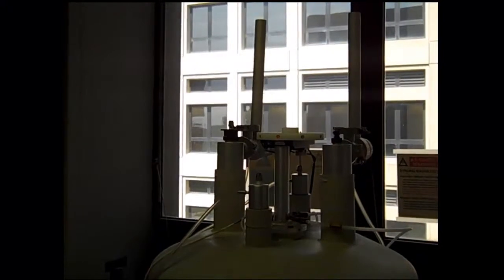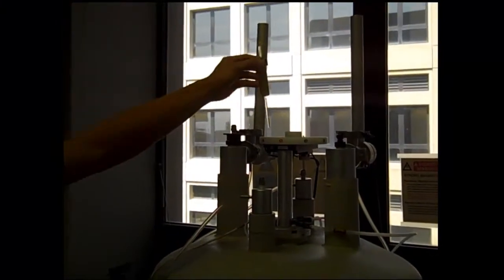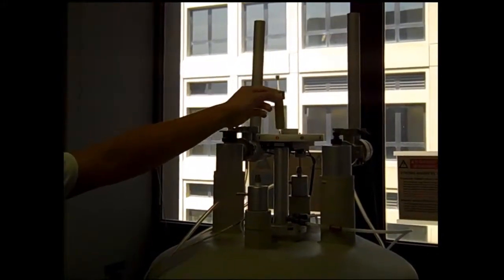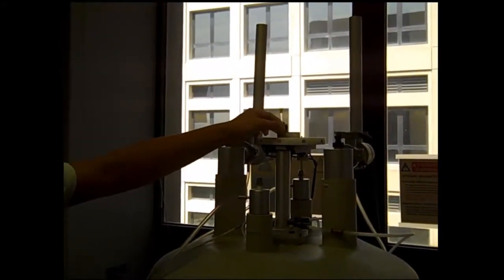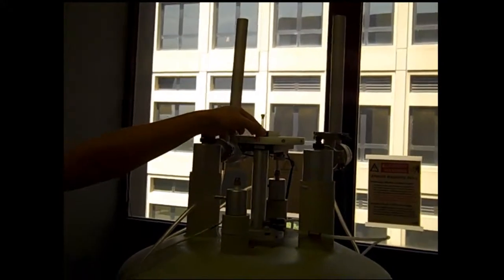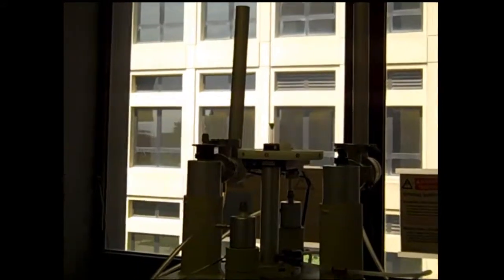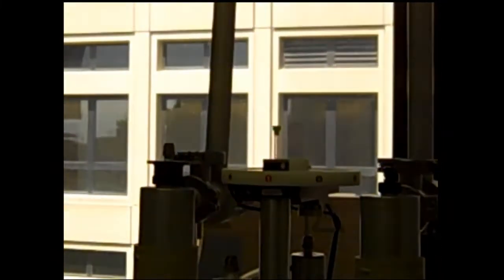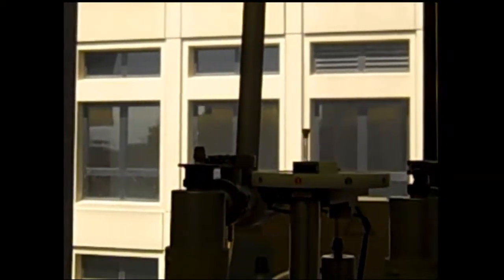Then place the sample back into the open tube and make sure that it's free flowing and bobbing up and down freely. That tells you that it's set well inside of the sample tube. Once the tube's in, you can hit the insert button, and that'll drop the tube back down into the NMR.